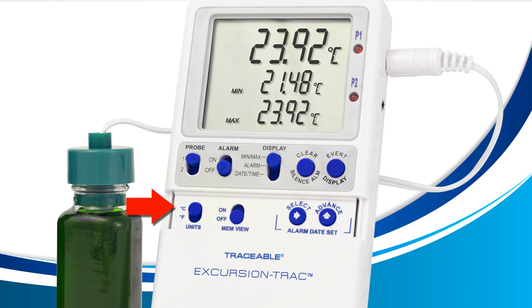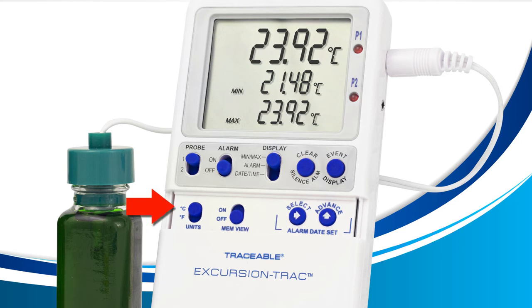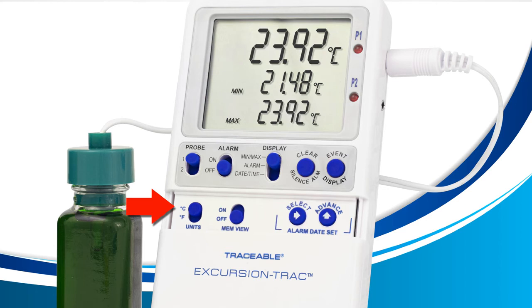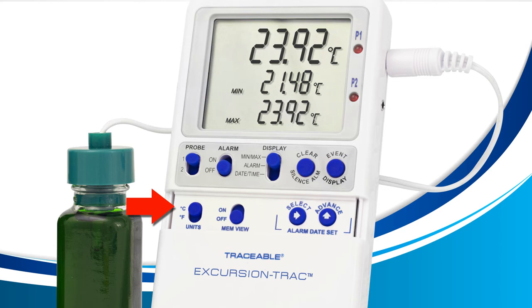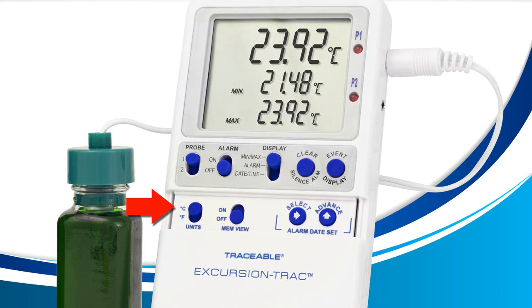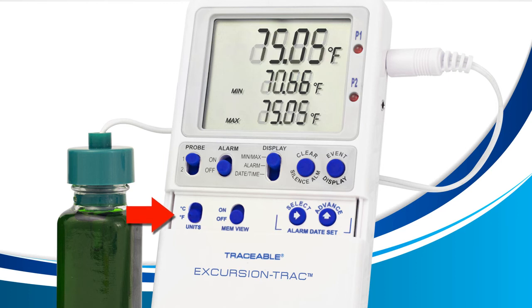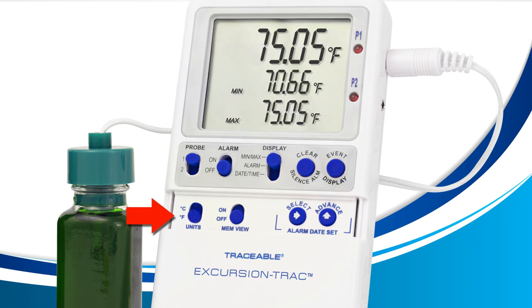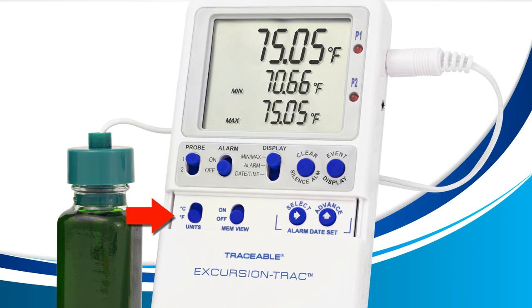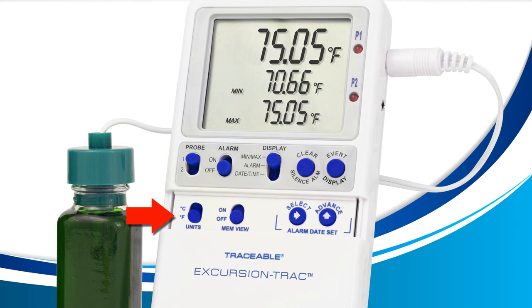Slide the switch down or up to choose your preferred unit of measurement. Sliding the switch down will display your temperature readings in Fahrenheit, while sliding the switch up will display your temperature readings in Celsius.